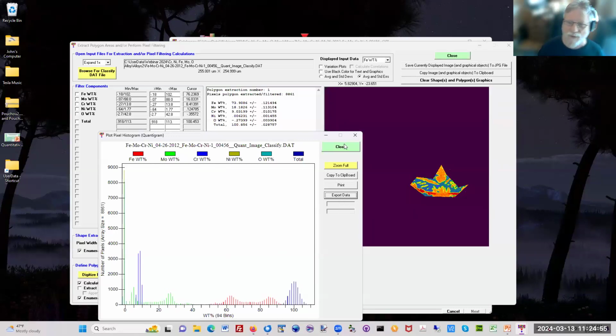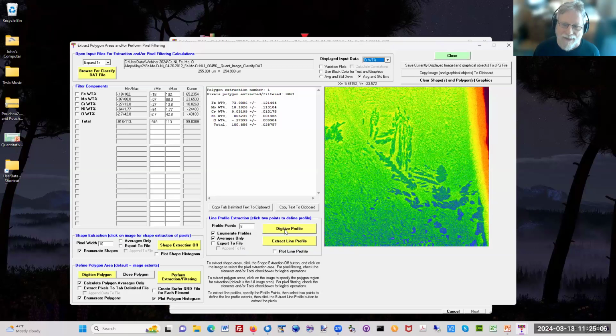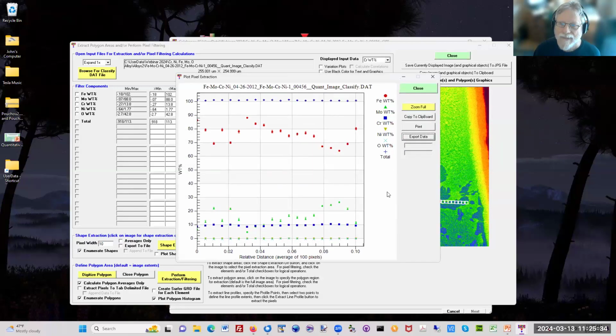So this can be very useful to correlate composition with area. You can also change which element you're displaying. So here, if I change to chromium, I'll now get the chromium map. And I can now digitize a profile. I can start, let's see, here and go to here. Then I can extract that and plot it up here. And now I have my map, including the total and all the elements there. Of course, you can define as many as you want, 20 points, and then you get that.